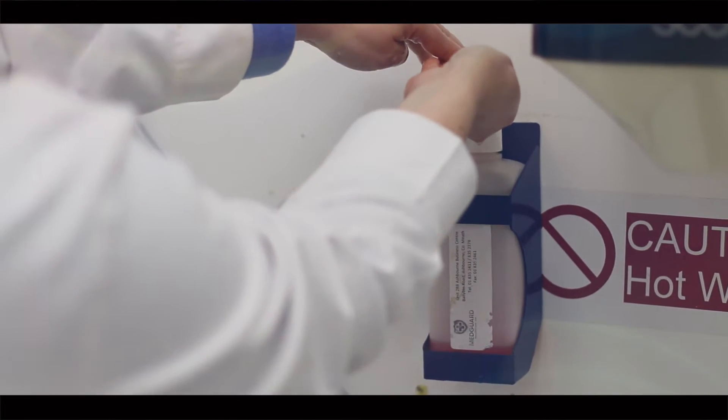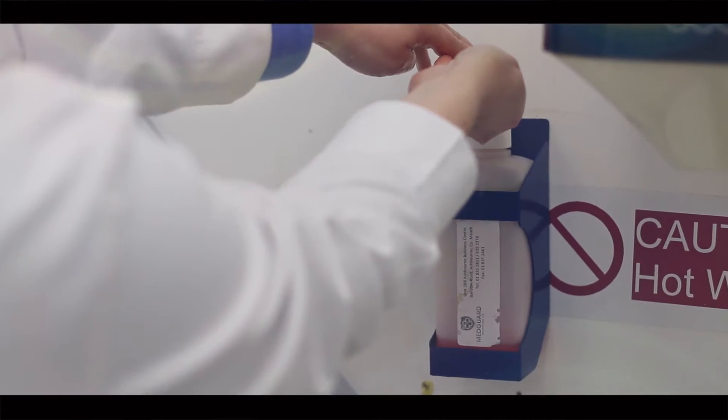Before and after we start our work, we need to wash our hands thoroughly. The appropriate hand washing technique includes several steps.